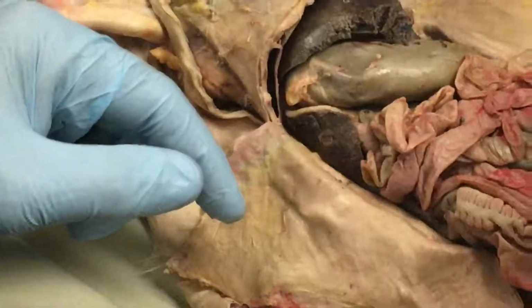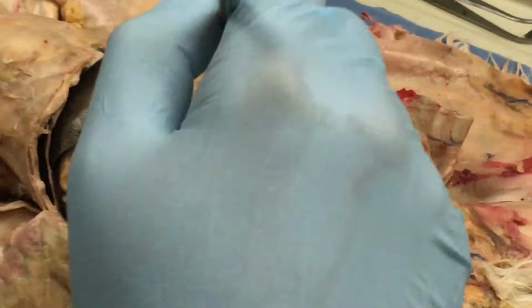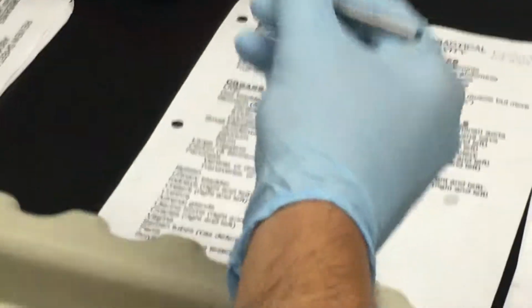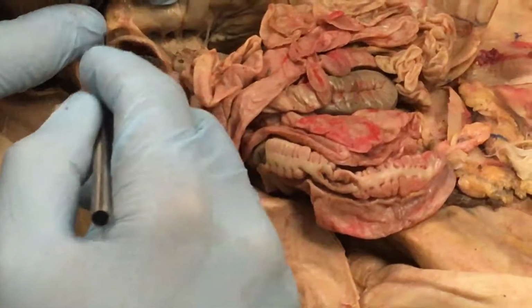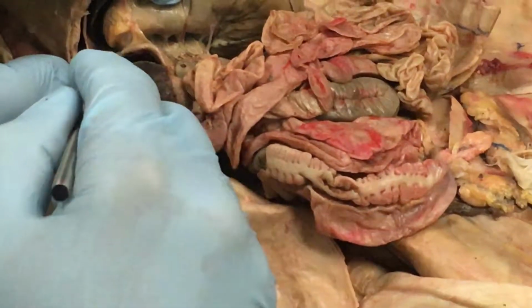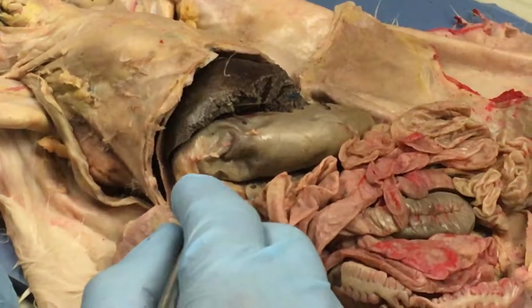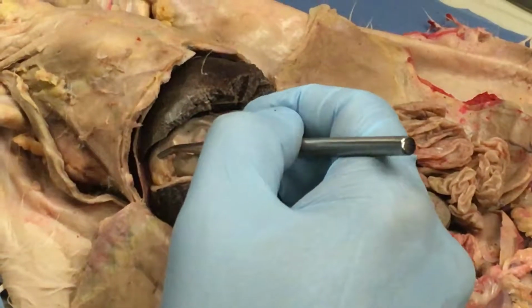Now, but here's what I am doing for you guys, because it really is hard to tell. It's much harder to tell on the rabbit than it is on the cat. I'm taking off jejunum and ileum. All you need to know as far as being specific about the small intestine is the very beginning part of the small intestine, and that's real obvious. It's in this little nook right here between this lobe of the liver and the pylorus of the stomach.